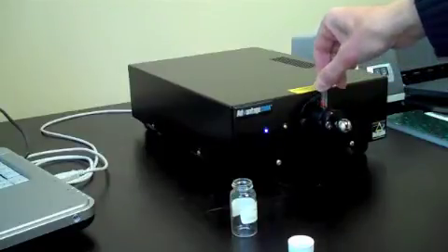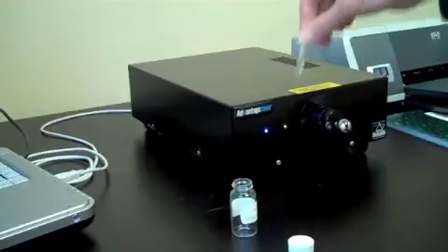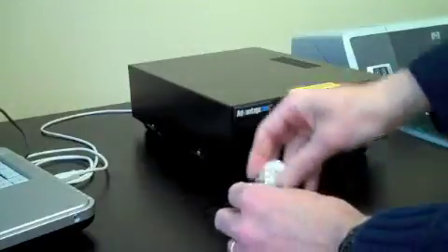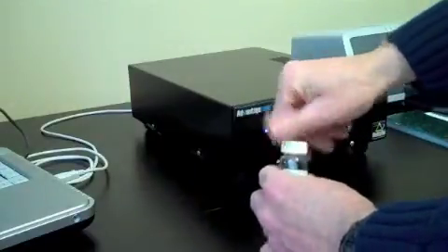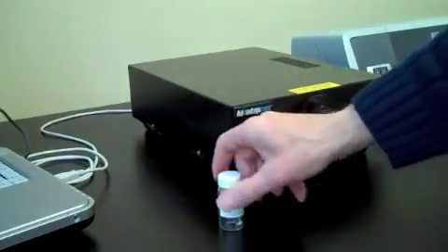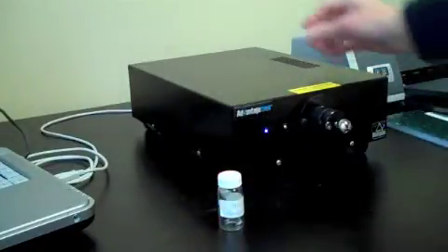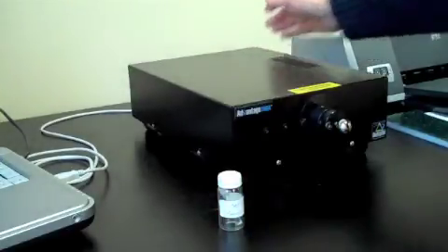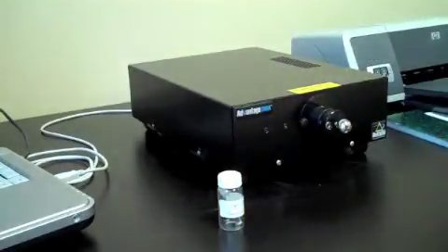At the end of your work, remove any samples from the instrument, clean up around the bench, turn off the power to the instrument, and sign your name in the logbook.